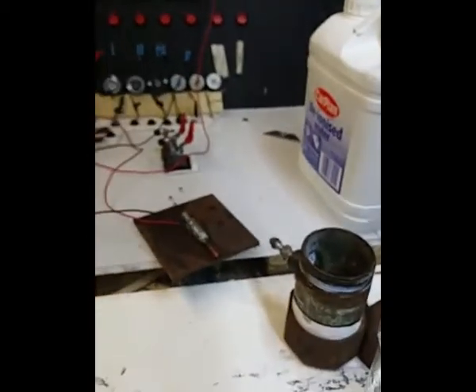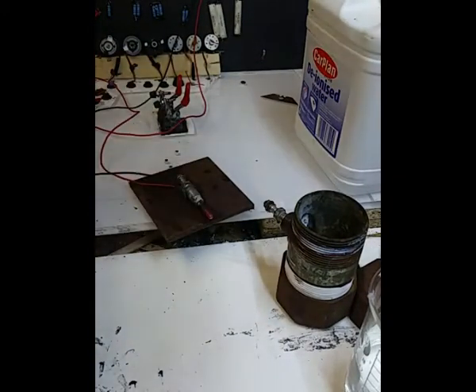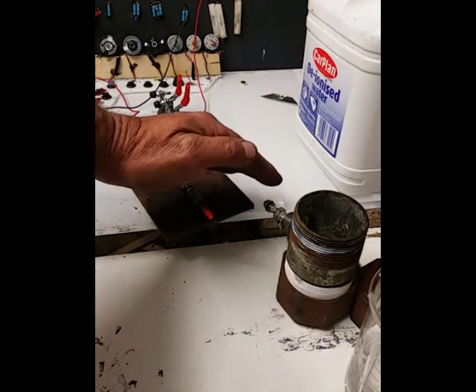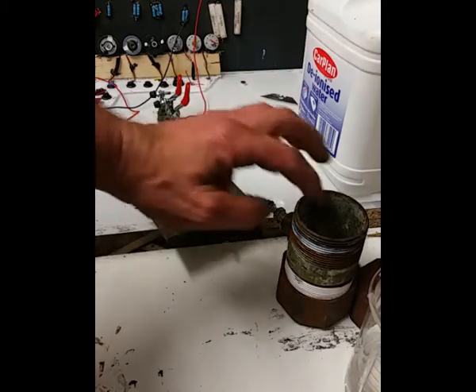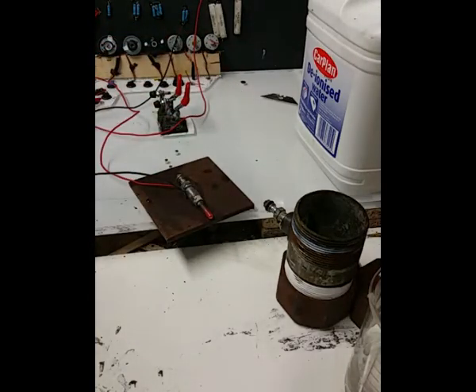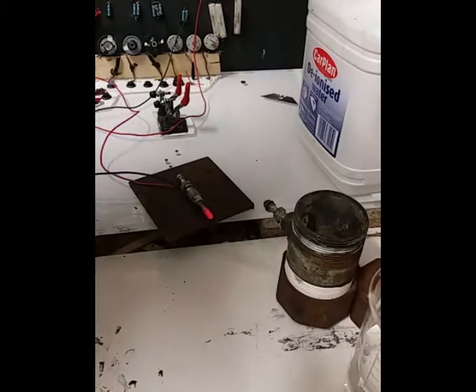Now at the moment that is glowing red. I'll turn a light out and you can see that glowing red. Now that's at 7 volts, so you can see it's a heating element basically. That's exactly what it is. I'm just going to turn the voltage down.